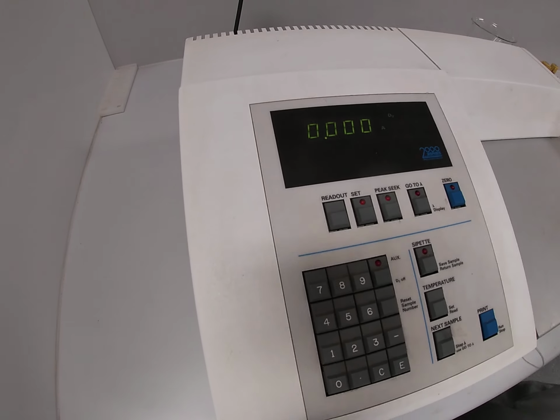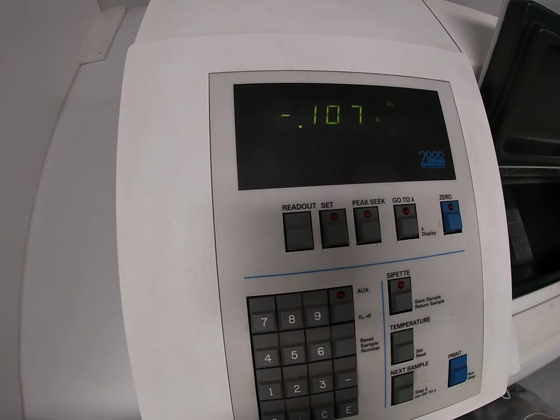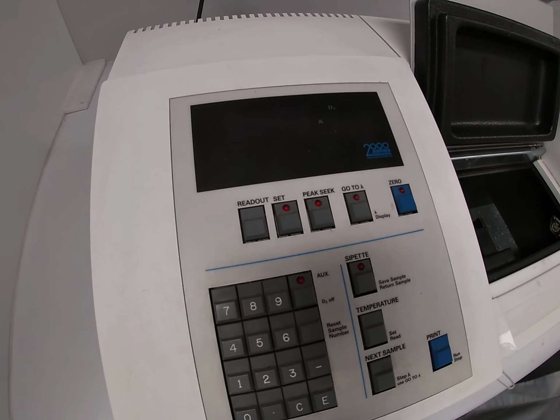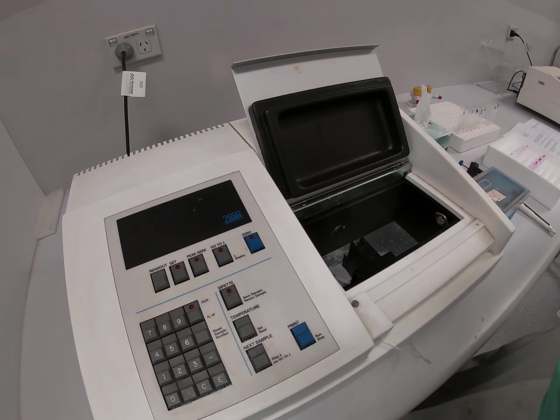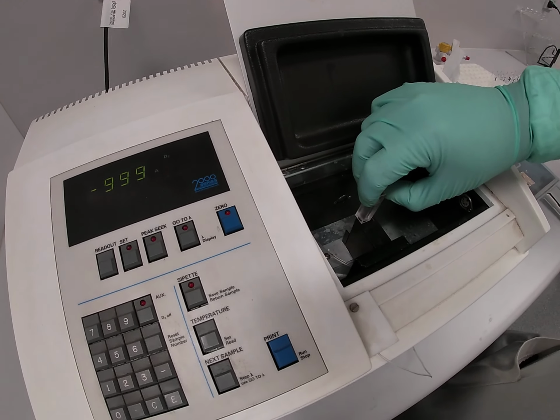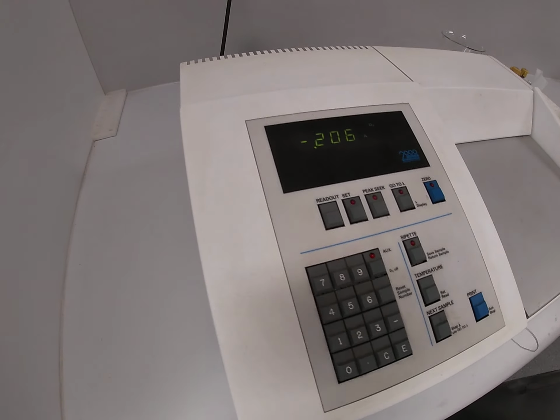So now all of our other readings will act as our reference. Okay. So now we take test tube number 2. Remember, test tube number 2 had the least amount of standard phenolphthalein solution, so presumably you'd have the lowest absorbance reading.